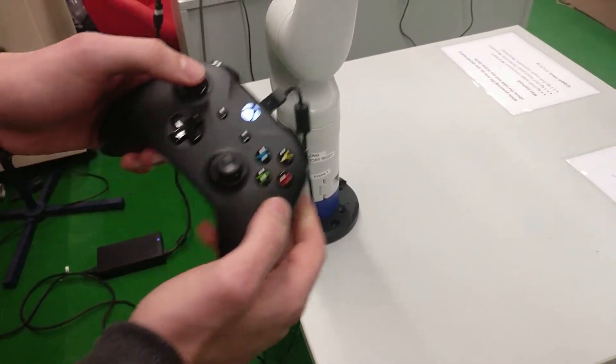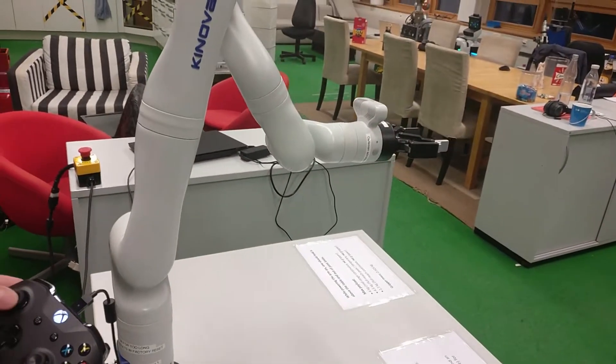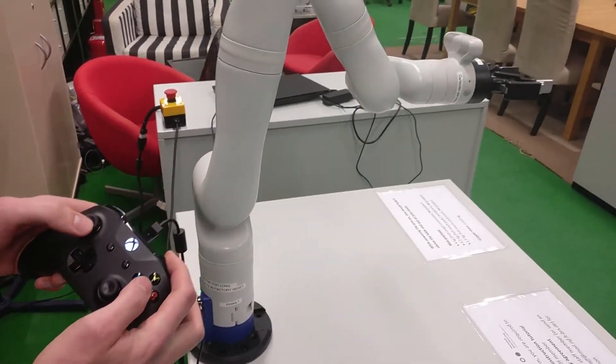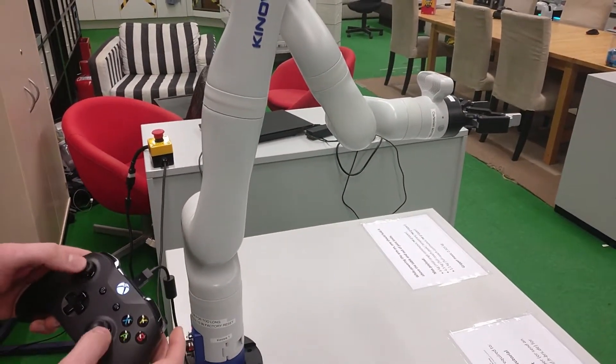So an example of this is you can control the arm, but then when safety stop is enabled, the arm can no longer be controlled.